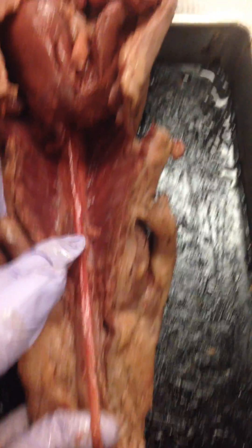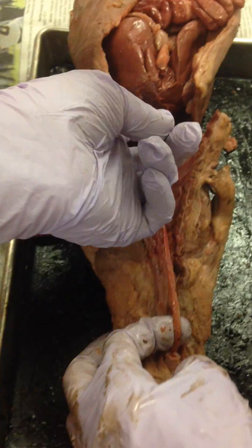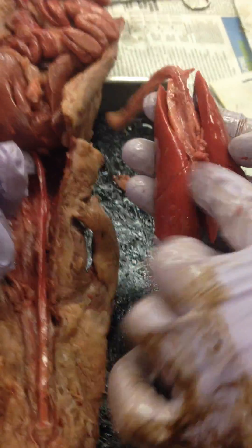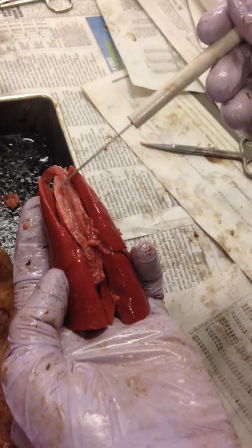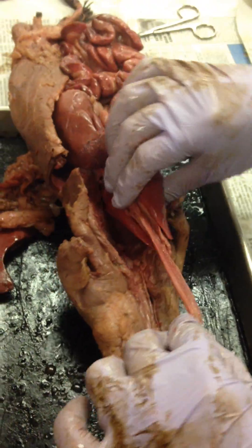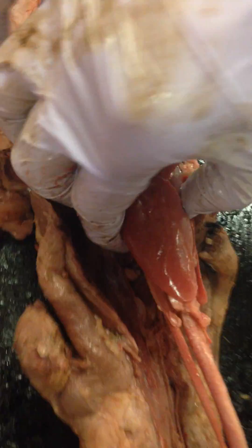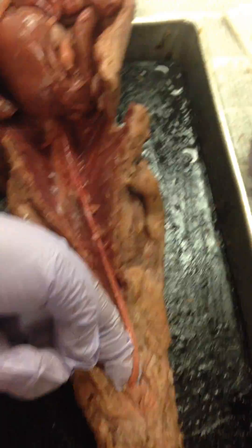Now I can see how deep that esophagus really goes. We always forget that the esophagus is so long. The esophagus was actually connected — do you see right here? There's that ridge, right in between. So the esophagus was literally tucked right inside of there the entire time. Your esophagus is always right behind your lungs and your heart — that's where you swallow. The mouth is actually really hard to open.